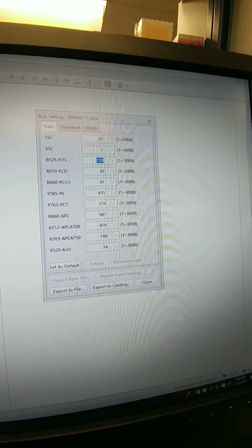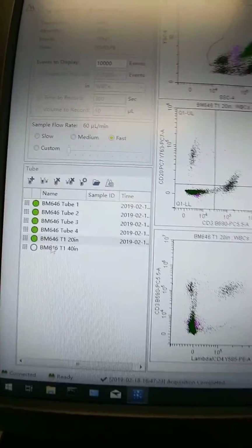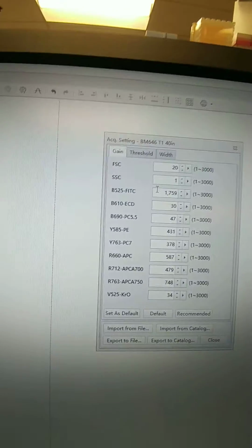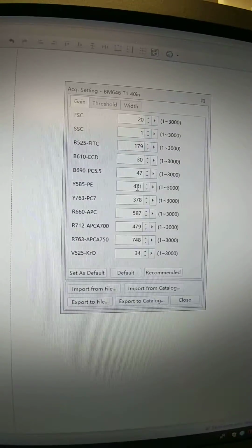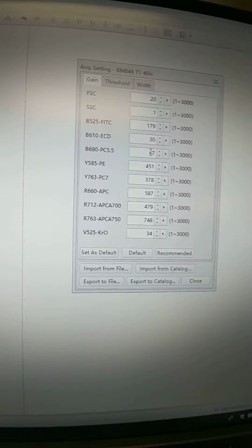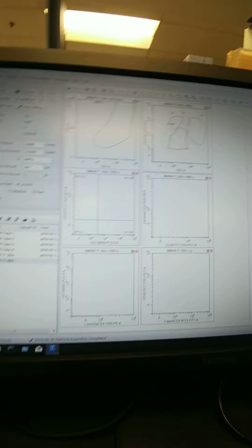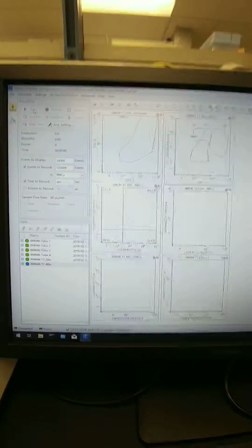Why is it not changing? Oh, because I'm on the wrong tube. It wouldn't let me change it because I was on a tube I've already run. So let's go back here and click that one. Now I'll be able to change the numbers. 179, and we changed the PE, so 451, and we changed the 5.5, so 67. Now we'll run and collect 5 to 10,000 events for this setting.